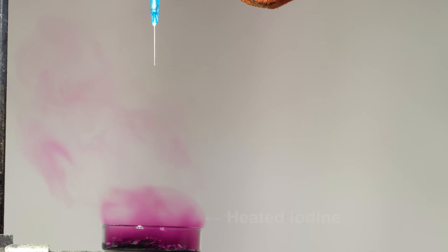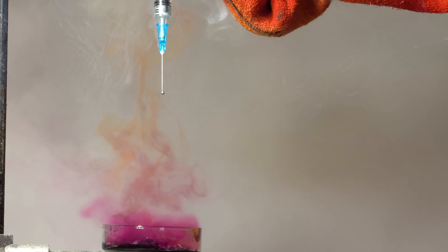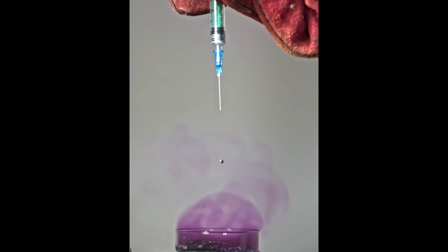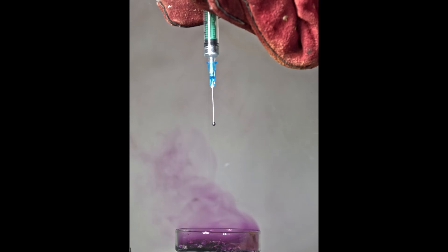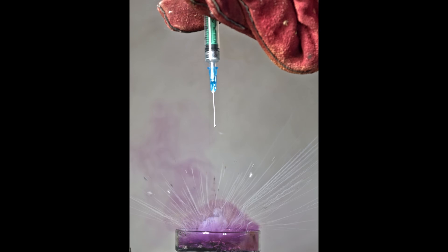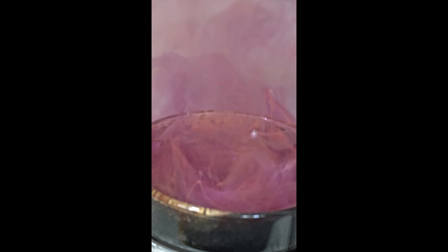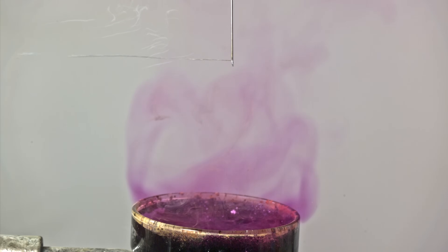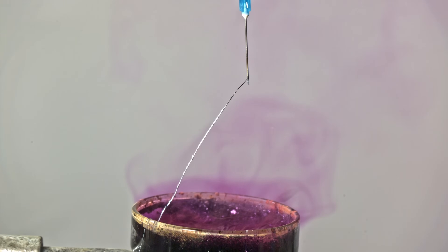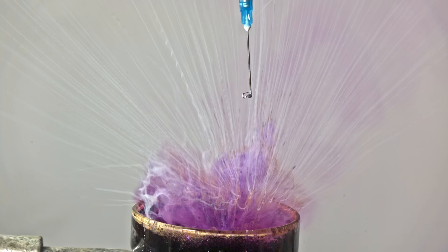I know you love the iodine reactions, so I've added that too. This is a very interesting shot – the liquid rubidium-cesium alloy, due to oxidation in air, hardened and formed something similar to a human figure. See for yourself if you find this similar to a human body – write in the comments.